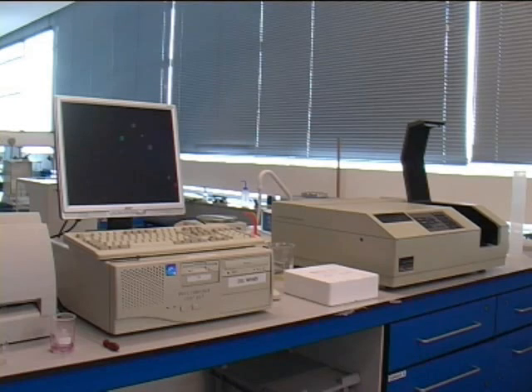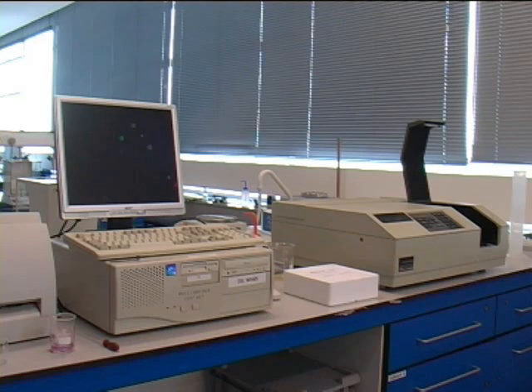In this video you will see the techniques required to run a UV-Vis spectrum. The theory side of UV-Vis can be found in a presentation elsewhere. This is the setup required for UV-Vis. On the right is the spectrometer and on the left the computer which will be used to analyze the data.